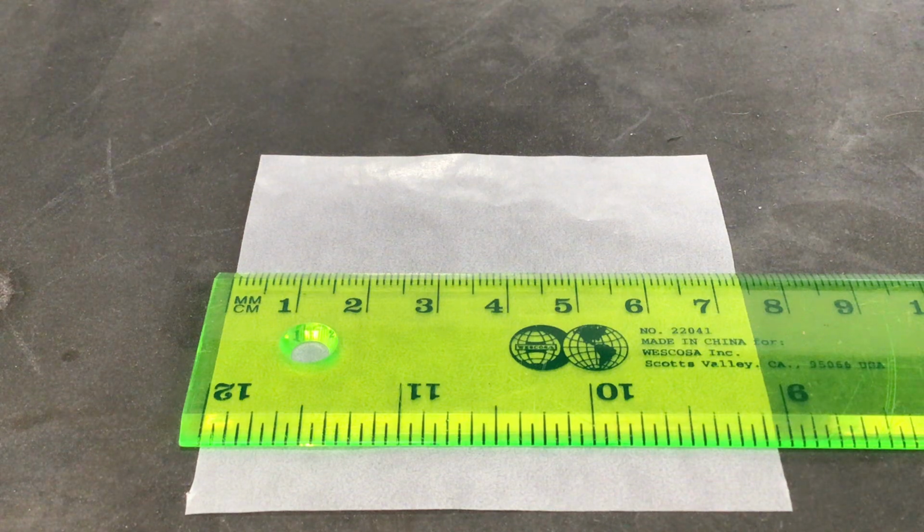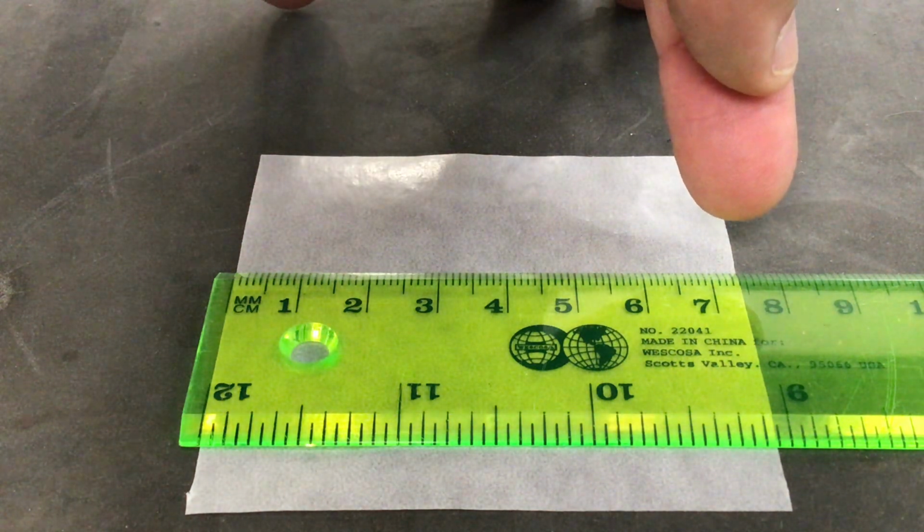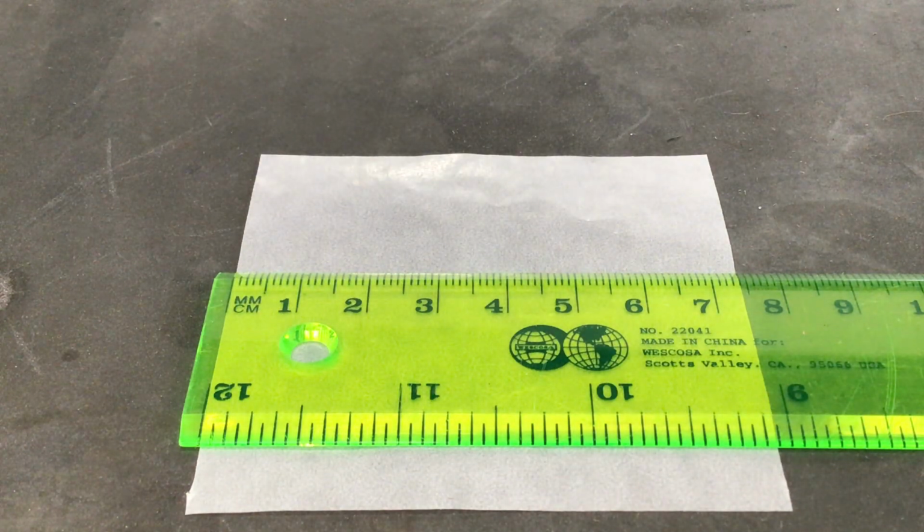So if I was looking at this measurement, over here on this right-hand side, I'm looking at where that paper ends, which is almost exactly on that 4th tick mark after the 7. And so I wouldn't just say 7.4 centimeters. If I think it's exactly on that tick mark, I could say 7.40 centimeters. Or if I didn't think it was quite to that tick mark, I could say 7.39 centimeters. And that's really how sig figs work.